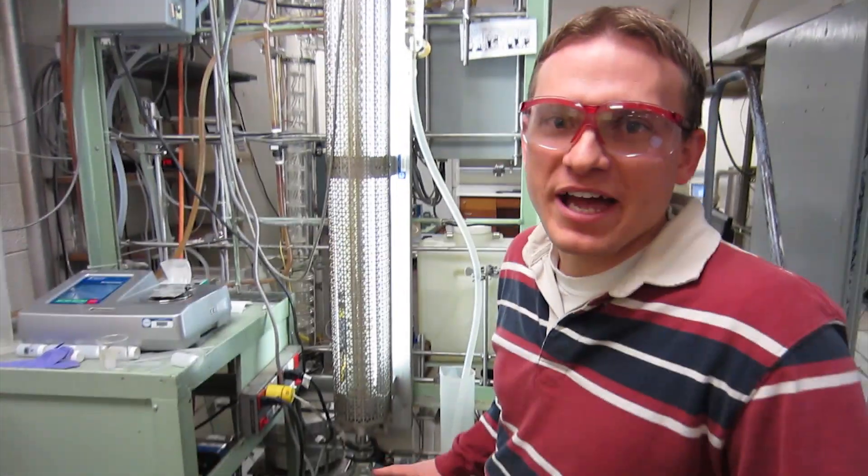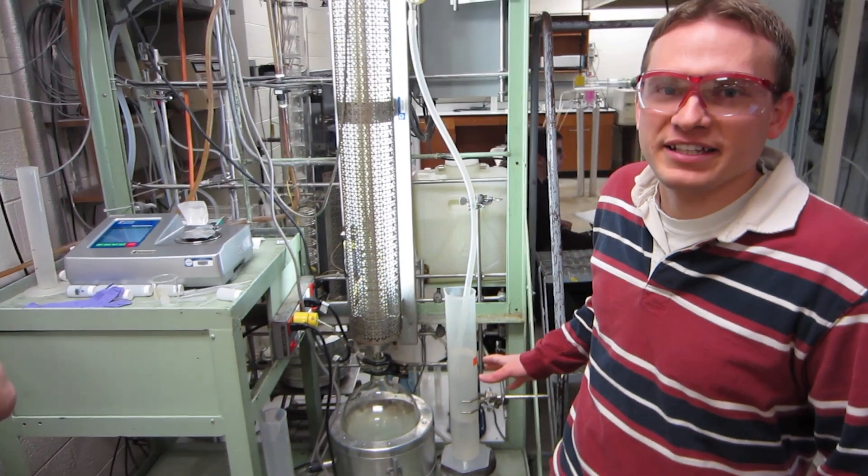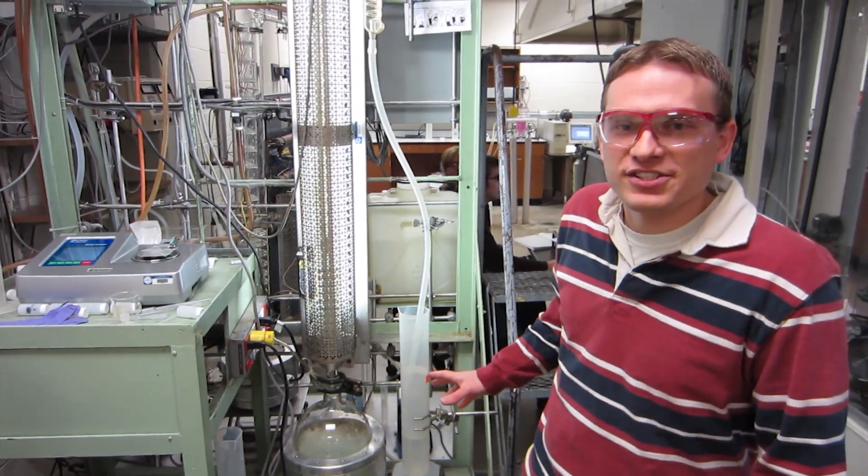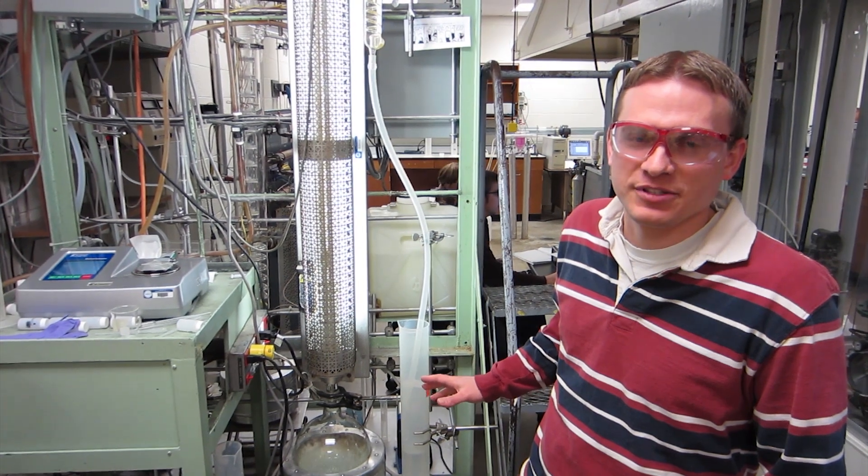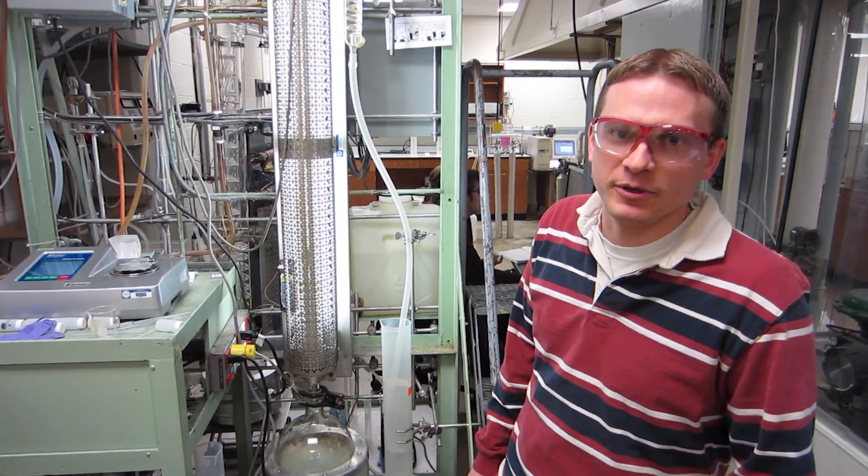One of the things you want to remember is not to try to start the batch column by yourself. This is something that Mike is going to do, and if you want to get started on time, it's best to tell him 45 minutes ahead of time so you can get some good data points in.